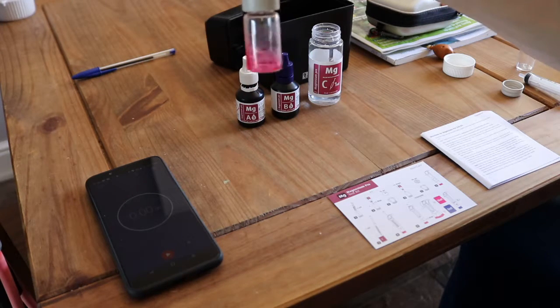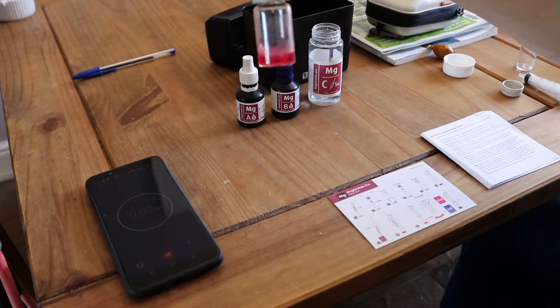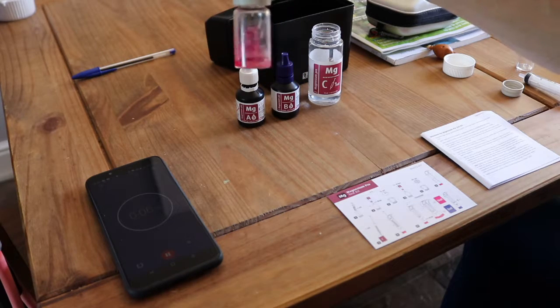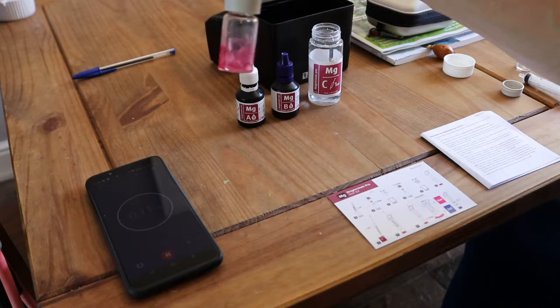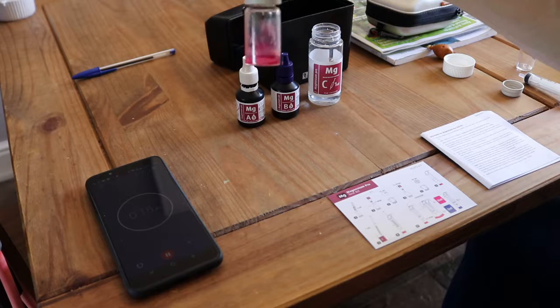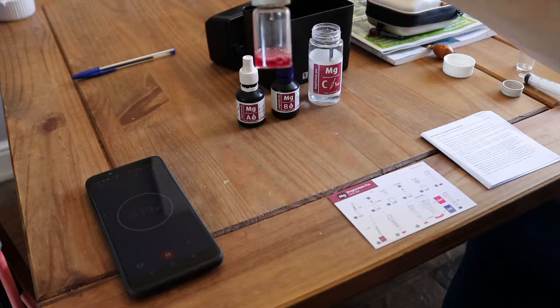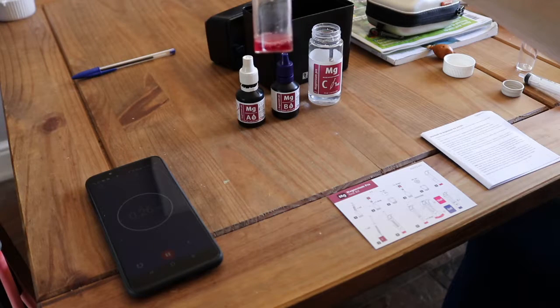Now another thing I've noticed on the Red Sea video is that from the moment he starts the third phase with the titration C, he takes about a minute before he gets to the end point. So another thing that a lot of people might be doing is rushing. So you want to go as slow as they do in the video, ideally, if you're having any worries that you're getting it wrong. So that's a drop and a shake and a drop and a shake. Currently I'm at 25 seconds and I'm already noting a colour change, so I'm just going to slow down a little bit.